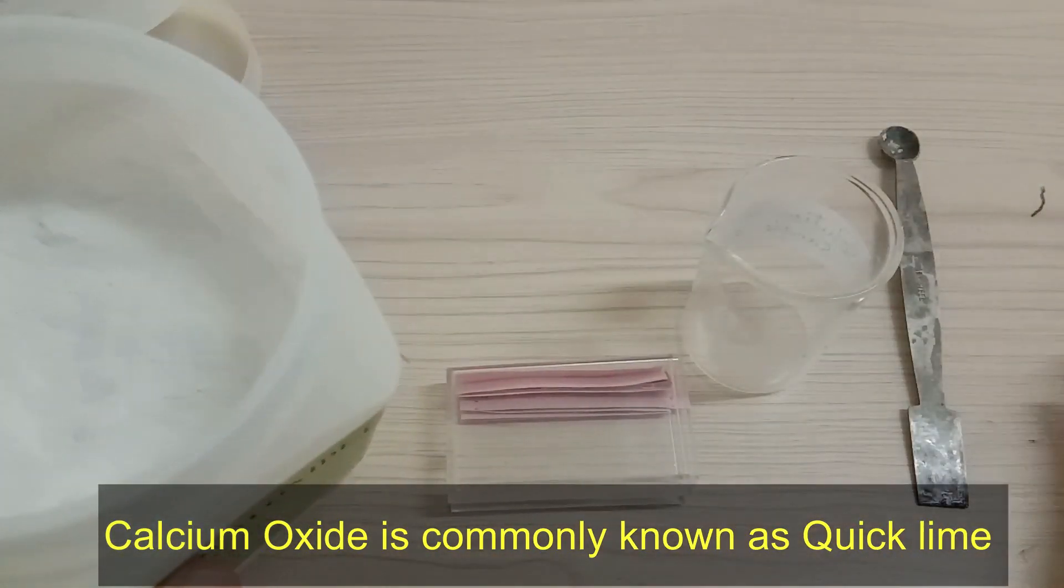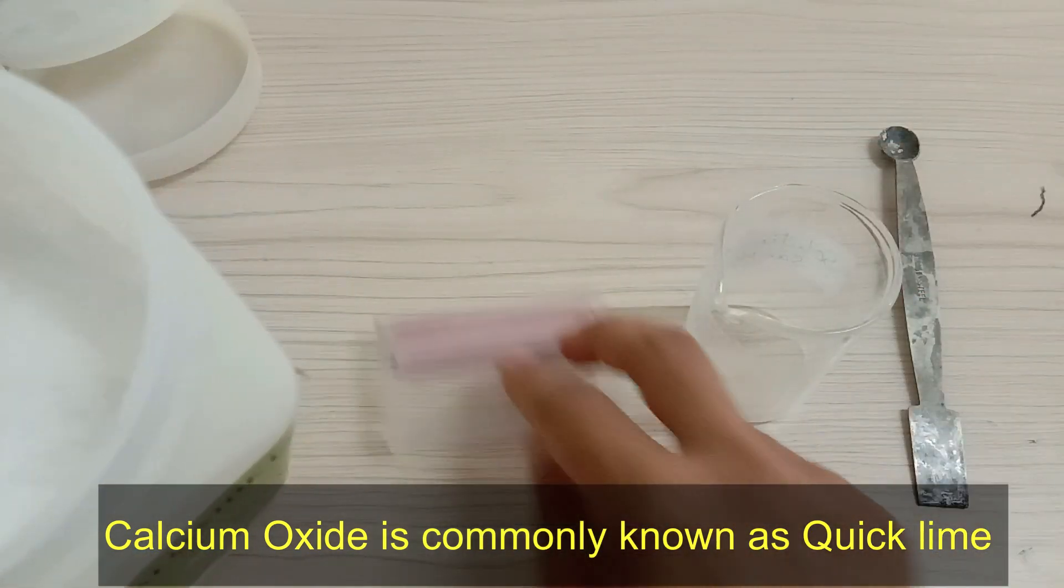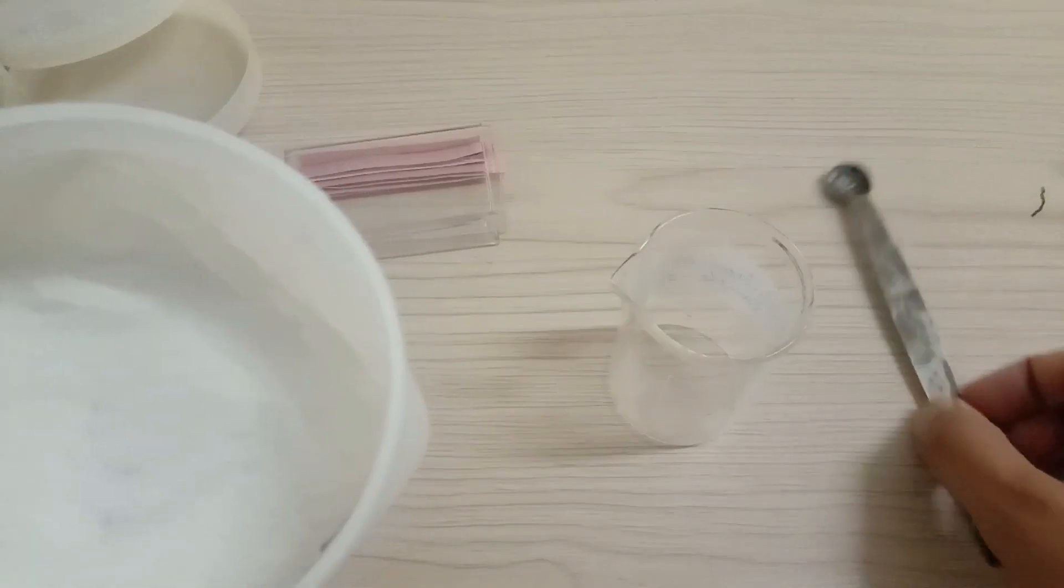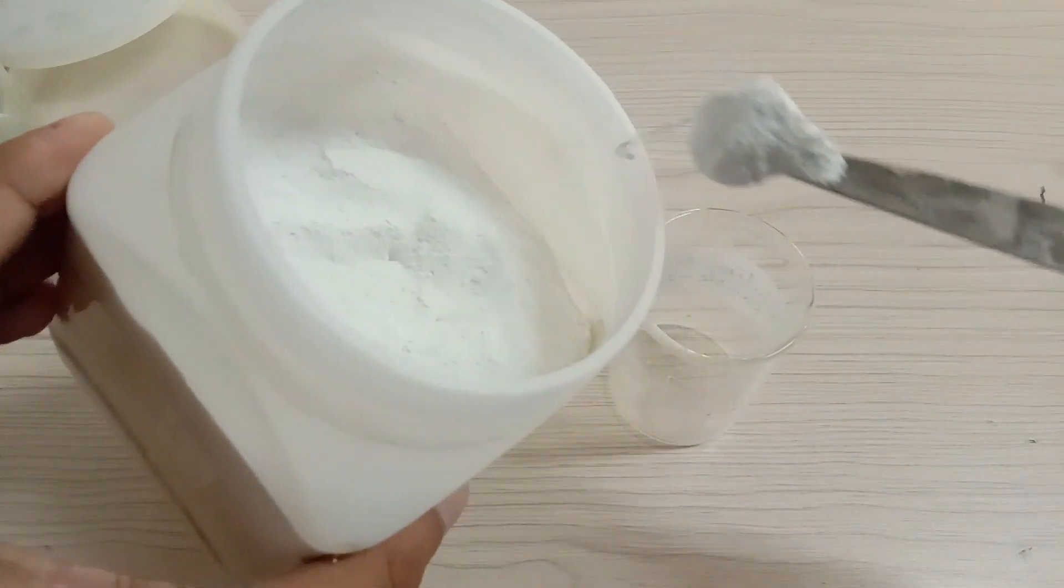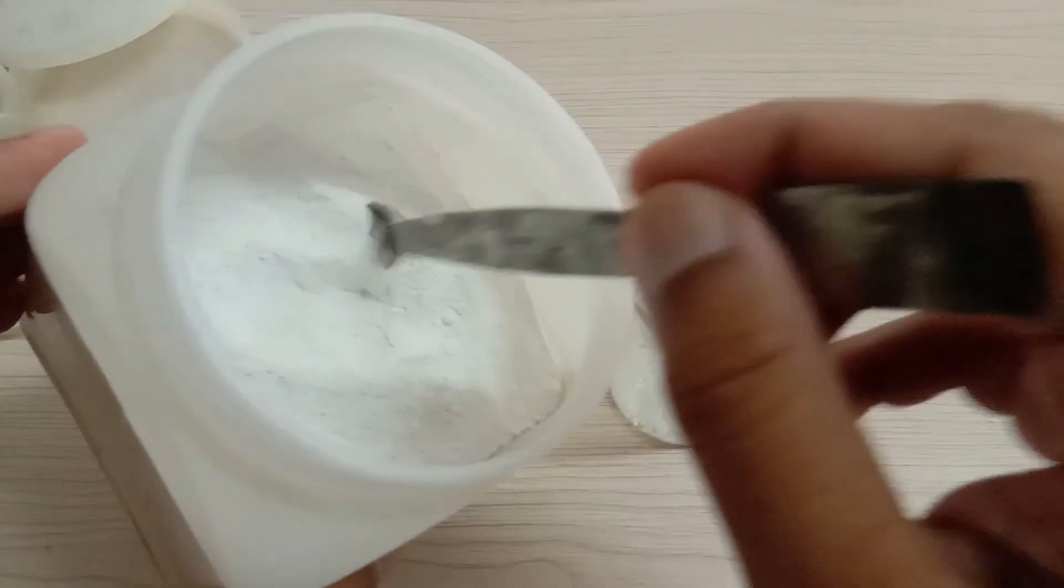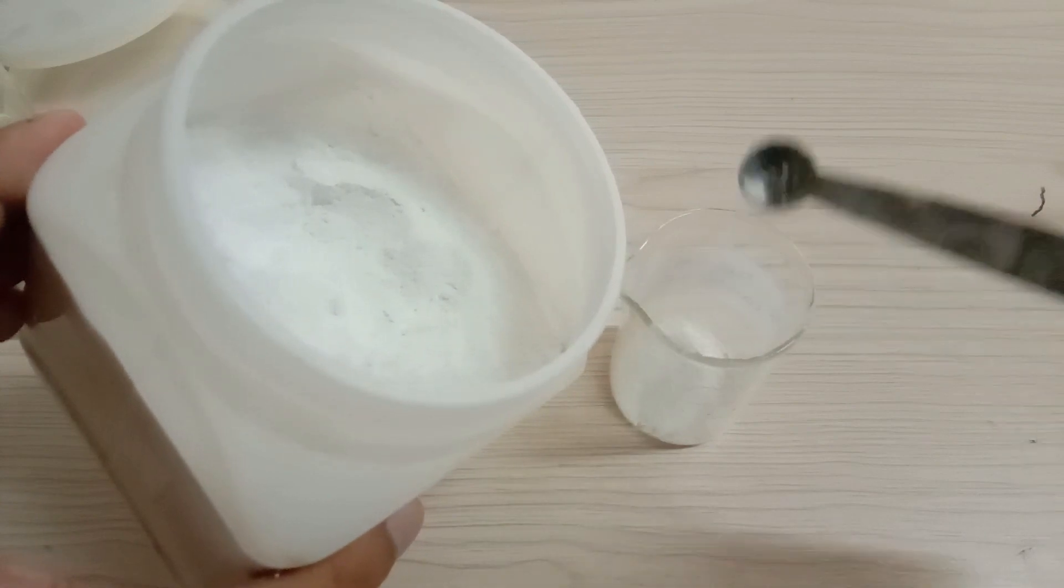So I am going to take some amount of this powder in this beaker, and let me tell you guys that this experiment is an exothermic reaction.